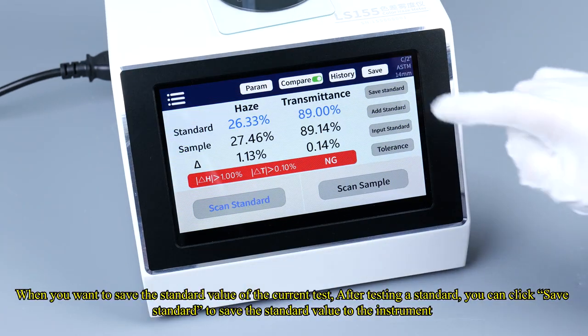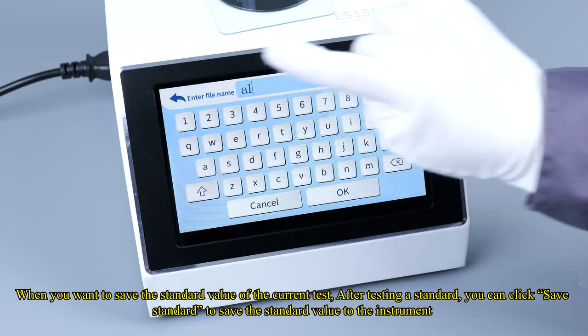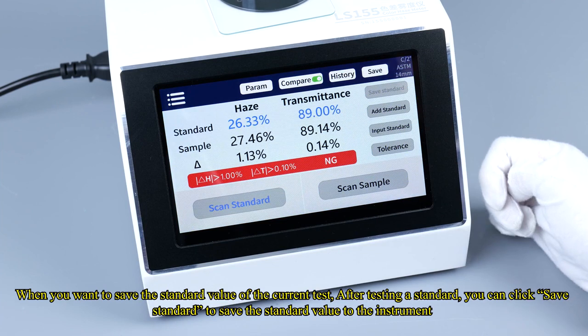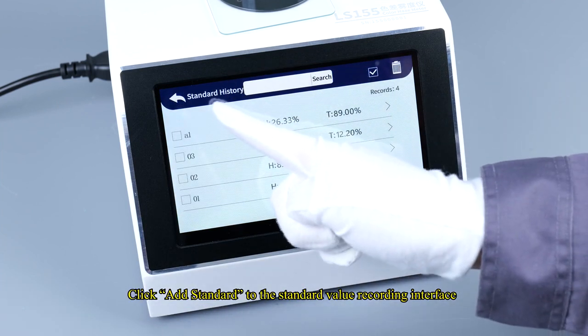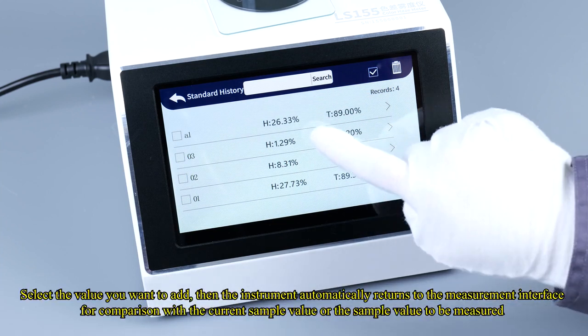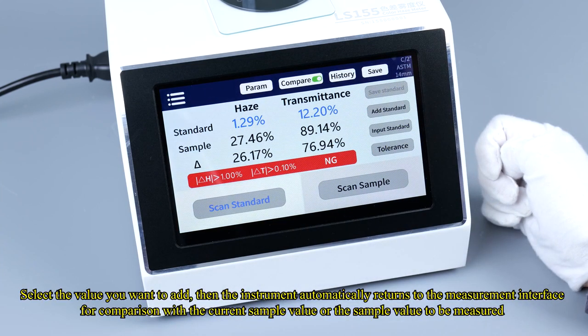When you want to save the standard value of the current test, after testing a standard, you can click Save Standard to save the standard value to the instrument. Click Add Standard to go to the standard value recording interface. Select the value you want to add, then the instrument automatically returns to the measurement interface for comparison with the current sample value or the sample value to be measured.